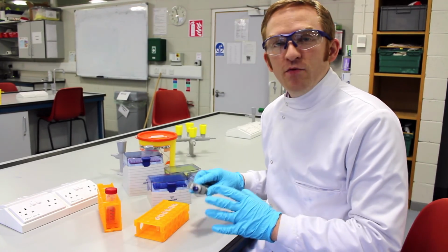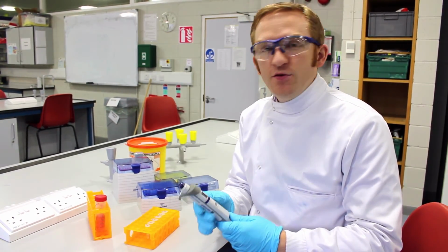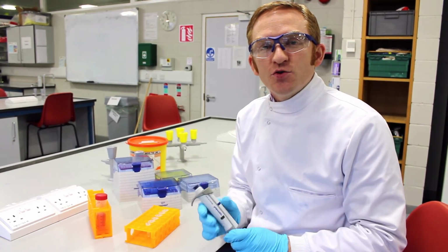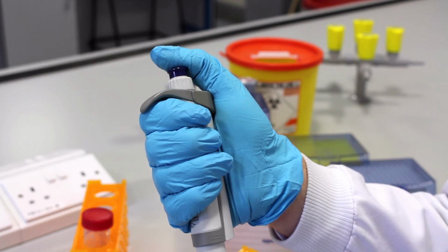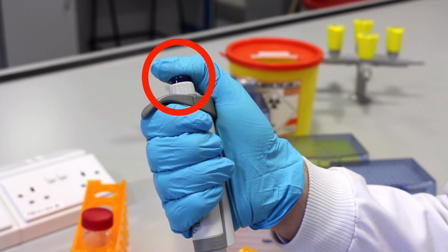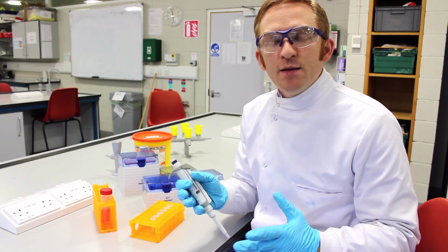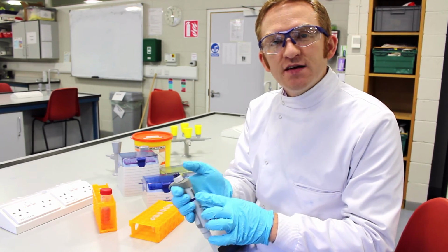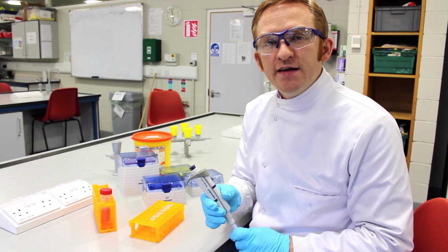I hope that's given you a really good overview of how to use these autopipettes or Gilsons, or a few different names they come by. But I must say this is the most important device that you're going to use within your scientific career if you're measuring small volumes. So just really pay attention that when you are pipetting, it's that first catch that's so vital to recognize. So even if you're in the lab waiting for an experiment, go to the pipettes, try them at different volume settings and practice finding that first catch. It's priceless and it'll really help your career.